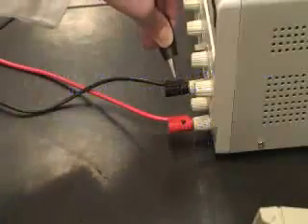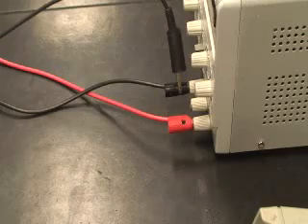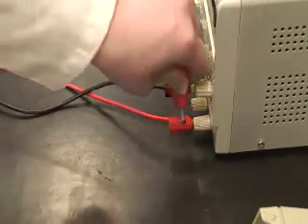Attach the black alligator clip from the voltmeter to the black banana plug on the amp meter. Then plug the red banana alligator clip from the voltmeter to the red banana plug on the amp meter.